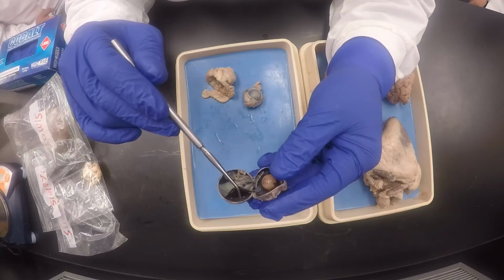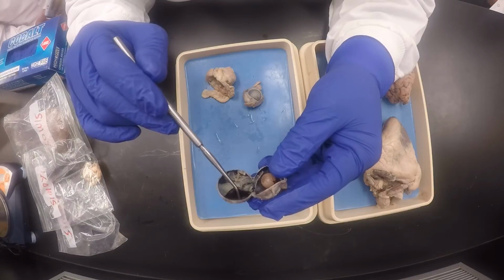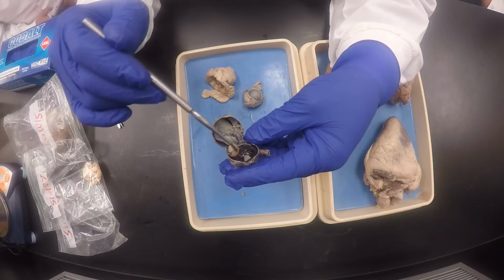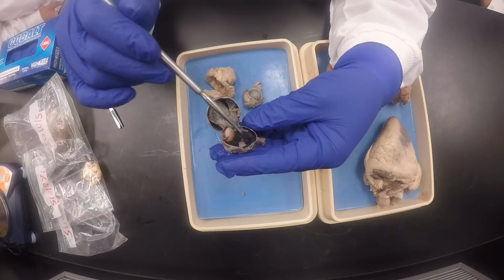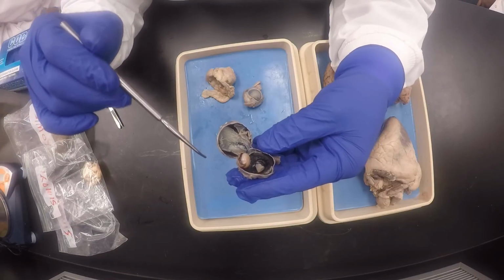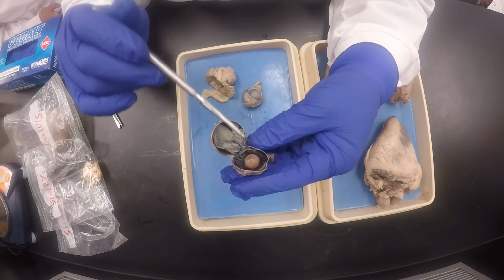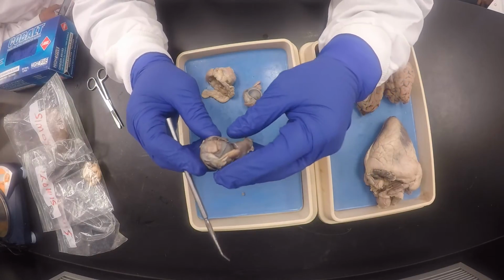And then this is the sclera, you see right there, the outermost layer. And then you can see here's the ciliary body if you're looking from behind. And the lens, we can scoot it like that. So there's the ciliary body, and you can see the ciliary processes, C-I-L-I-A-R-Y, from the ciliary body. The ciliary body suspends the lens there in the middle. And that's it. Those are all the parts, internal and external, for the eye.